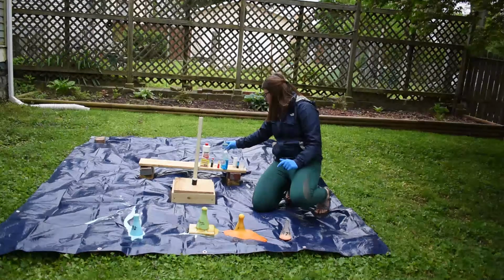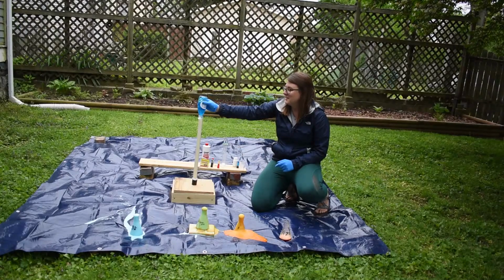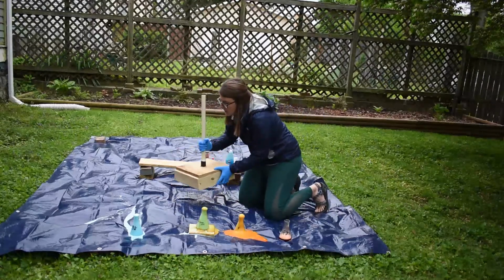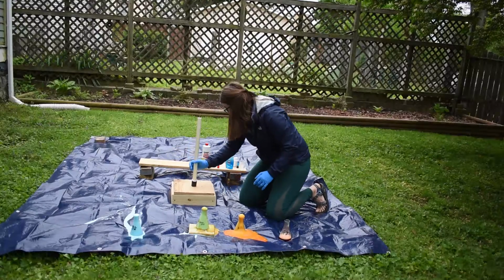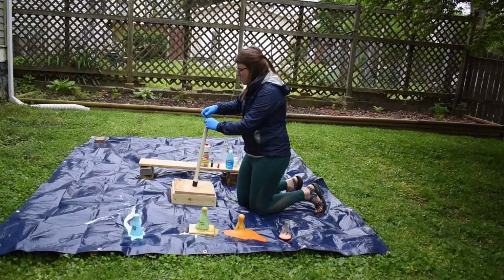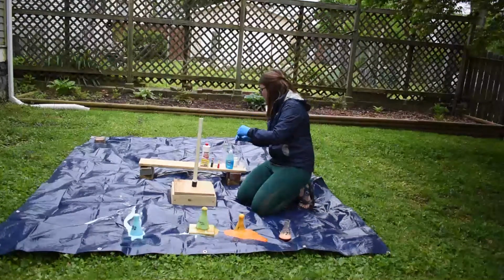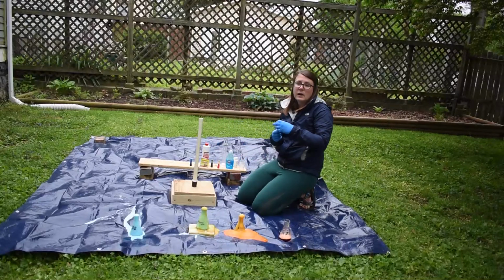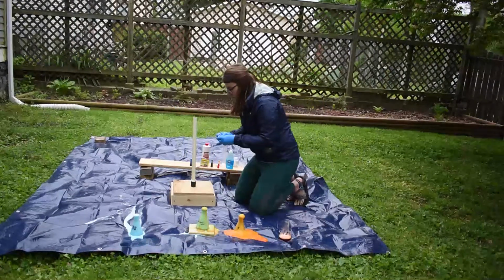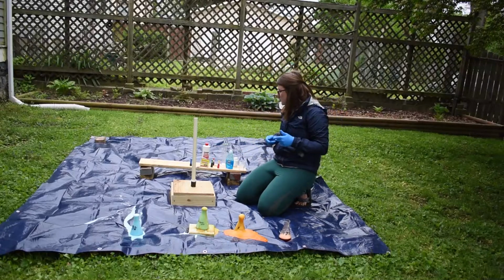So that I don't forget, I'm going to put the soap in right now. We got a glug of soap in there. We'll give it a good mix. Then I'm going to put some blue food coloring on that side and some red food coloring on the other side. We're going to see if we can get it to actually look like toothpaste, with stripes in it. That's where the name of this demonstration originally came from, because toothpaste has different stripes of colors.